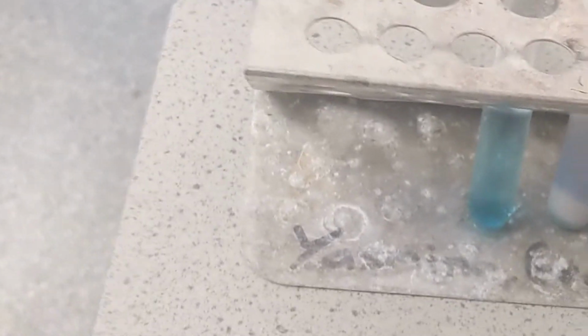So this is one of those tests that tells us whether something is present or not, but it also kind of helps us know how much of it's present, okay? We can use this to see if there's a lot of sugar, a little sugar, or no sugar present. Cool. So we've got two down. We've got starch, we've got sugar. Let's move into our next one.